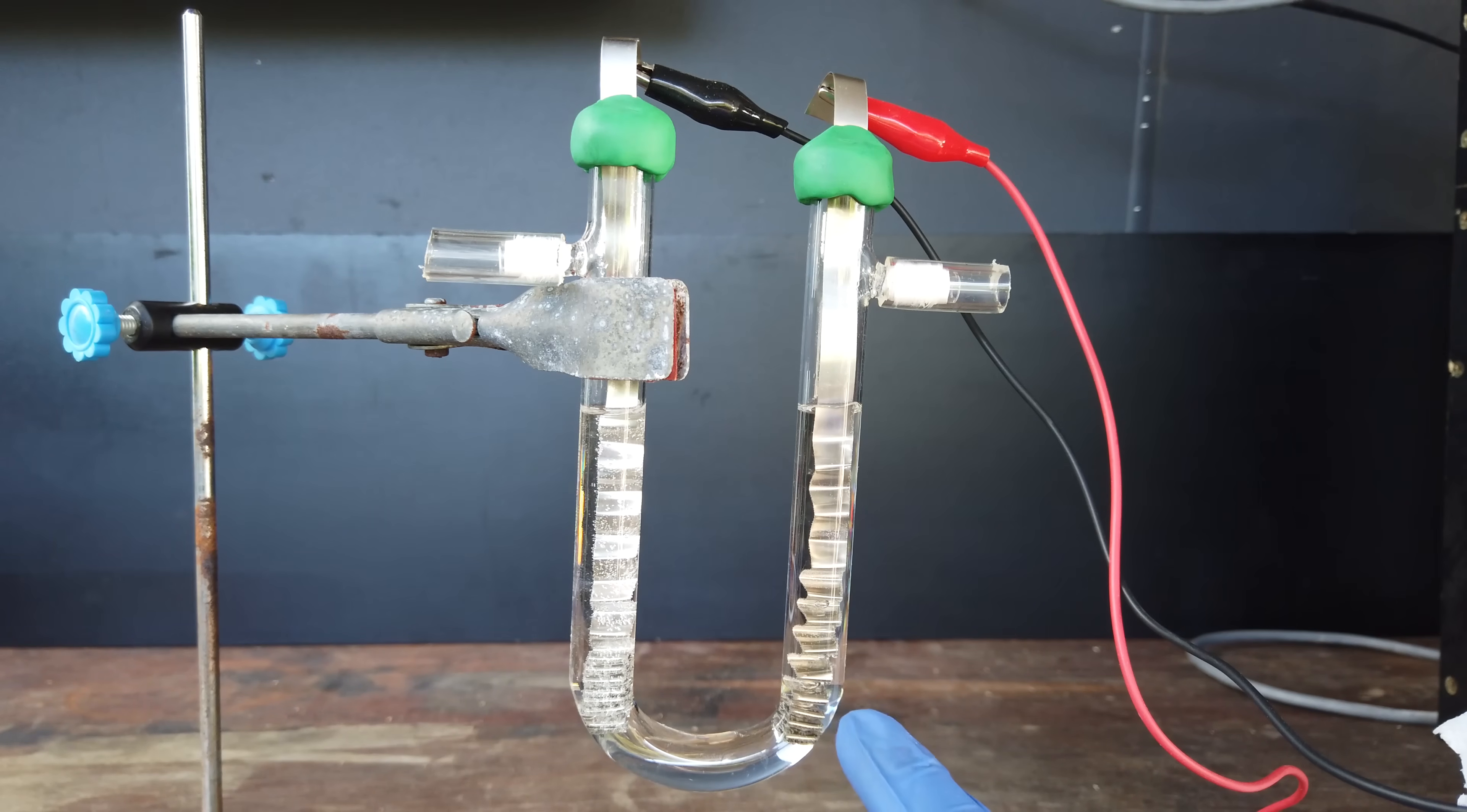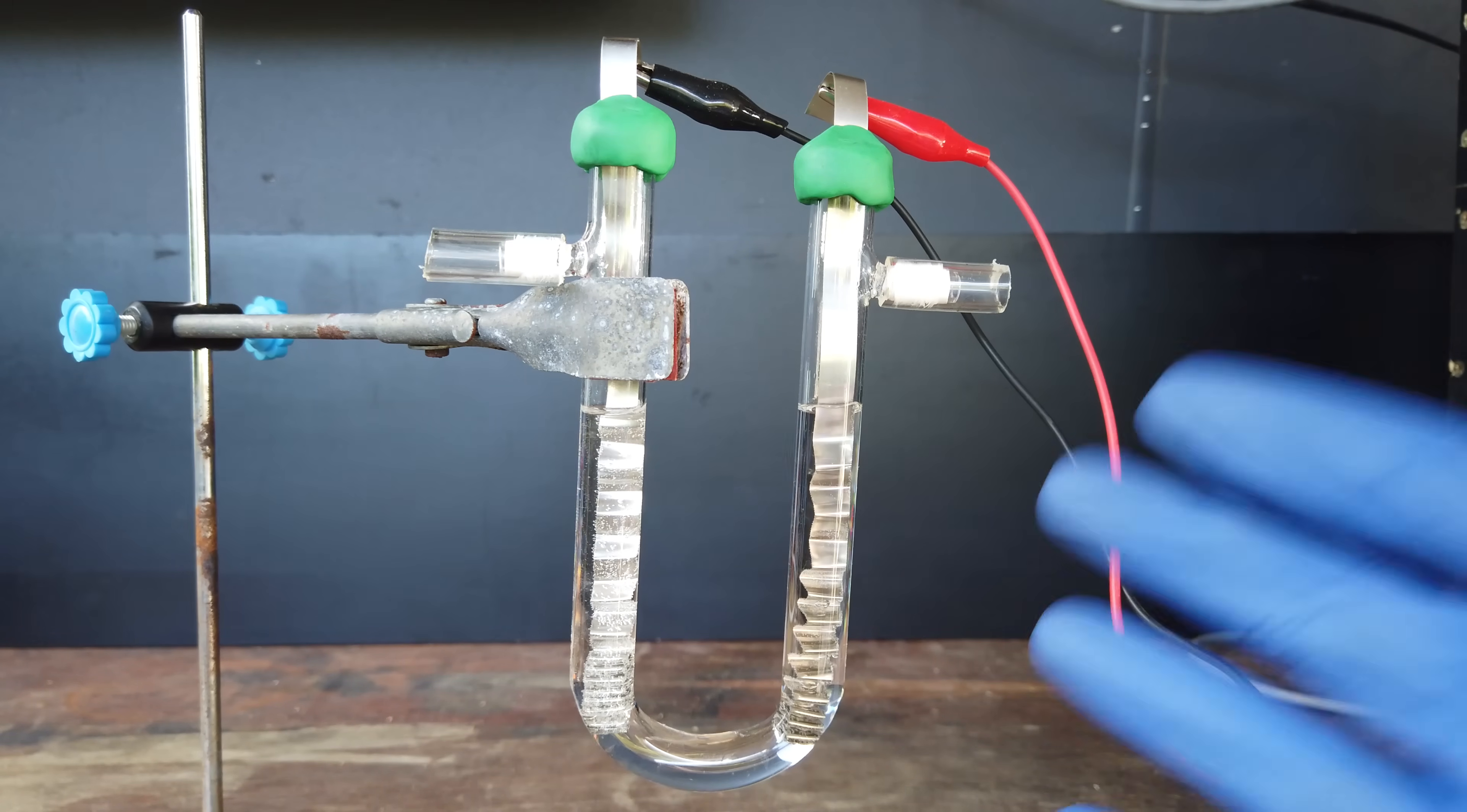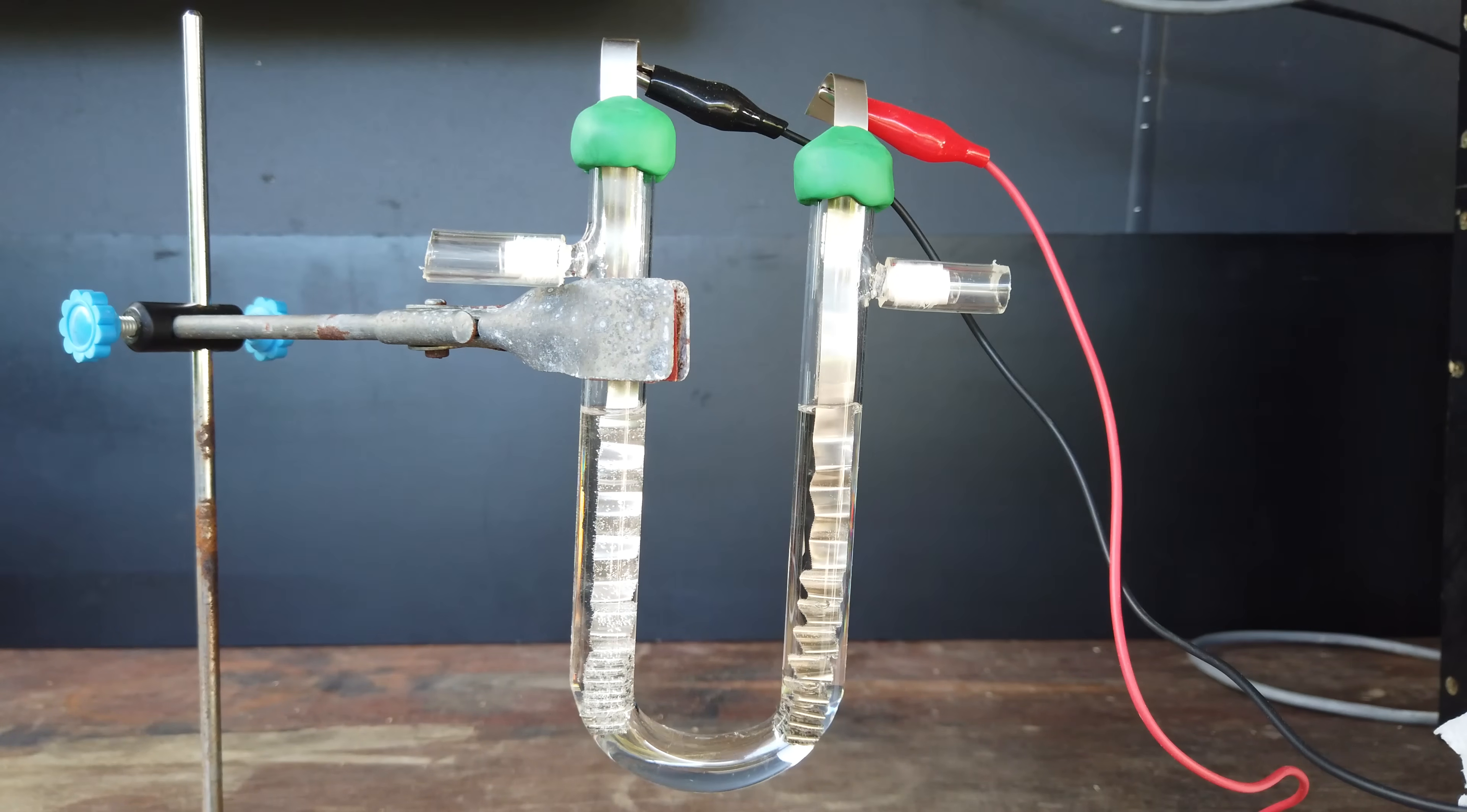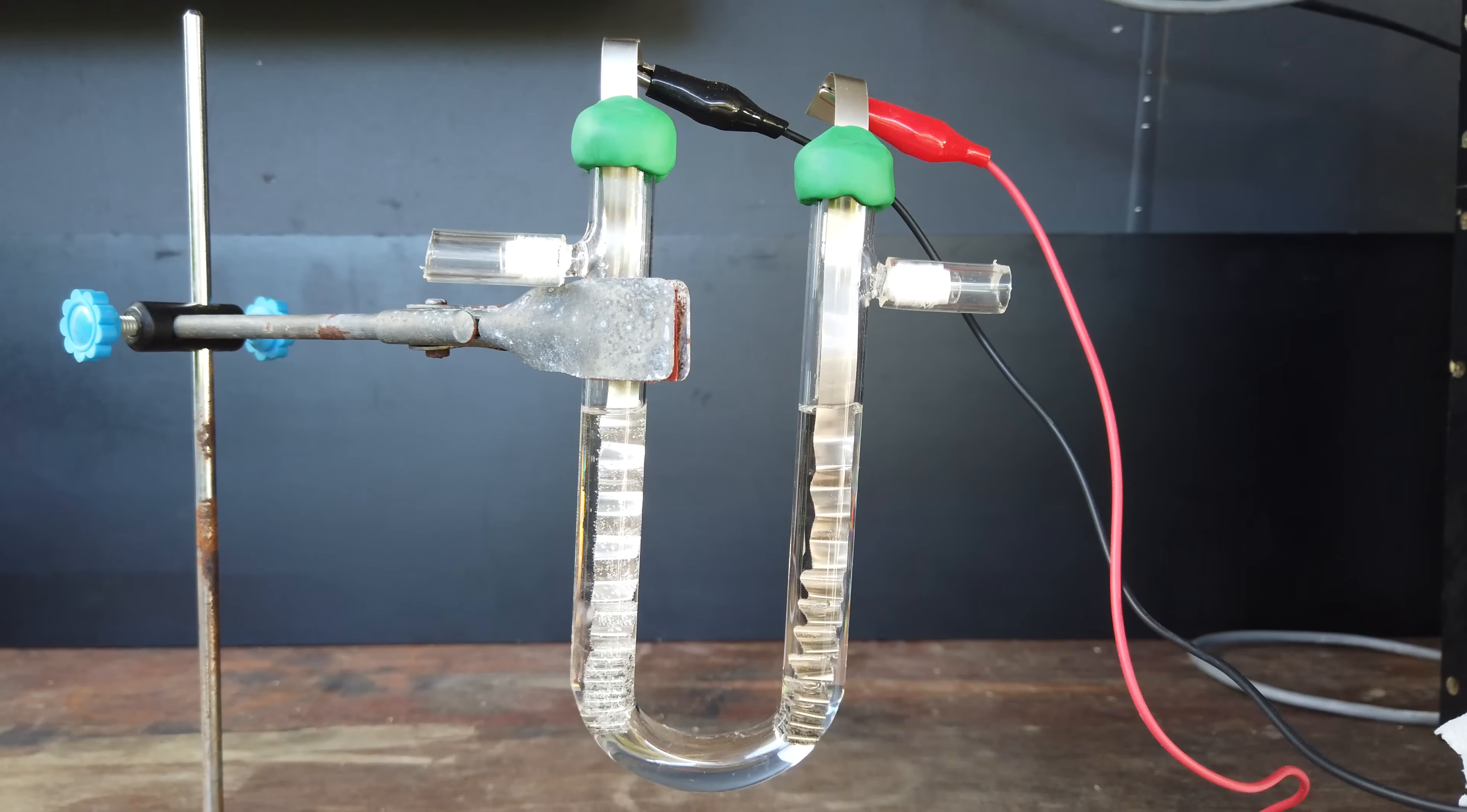On the anode, you can also see if you look very closely and you have set the video to a high resolution, you should be able to see tiny little bubbles of what we hope is nitrogen gas.